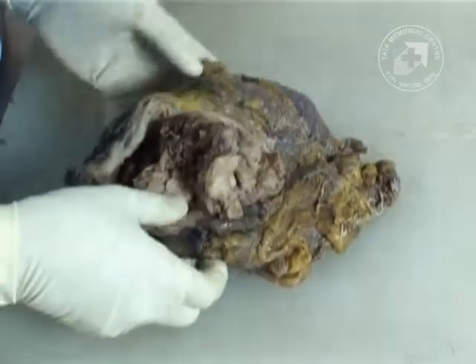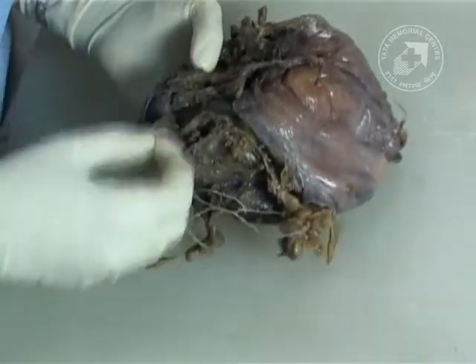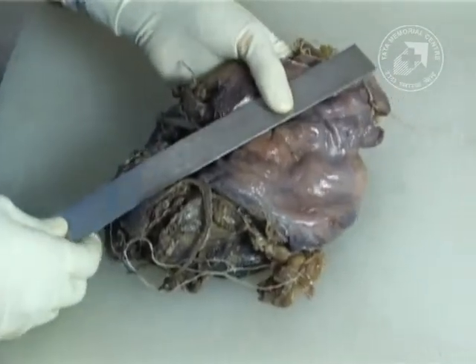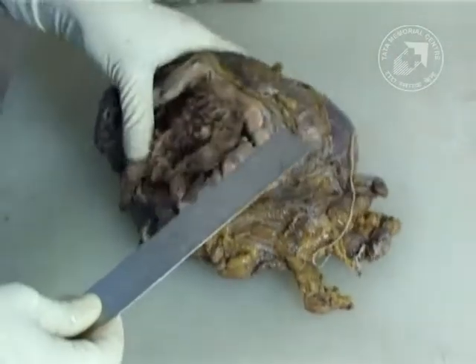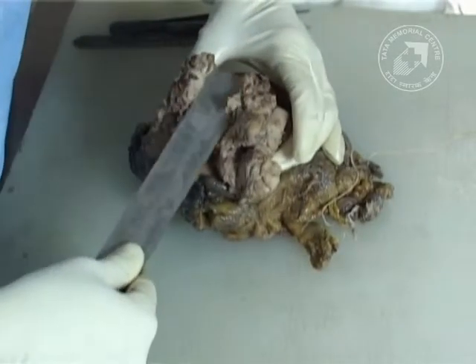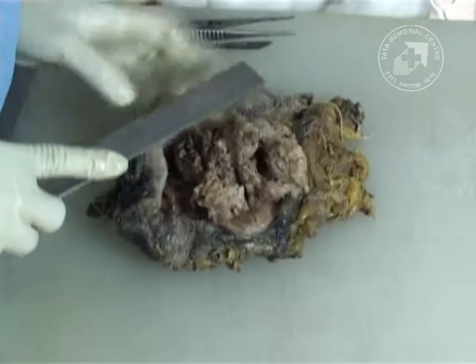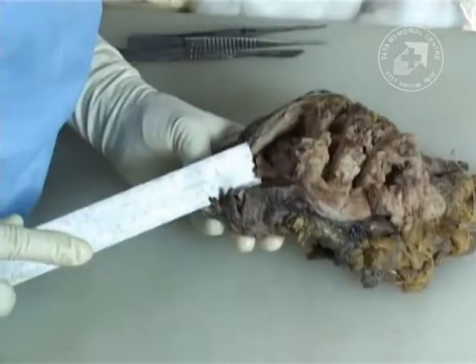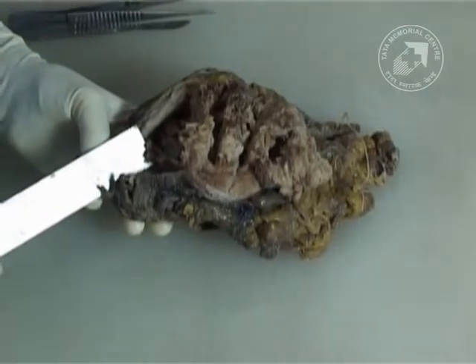This is the post-fixed specimen showing the tumor and the bladder. You can see the shiny peritoneal surface. Now we take the usual measurements of the bladder — the length, breadth, and the thickness — and then continue with the measurements of the tumor. The tumor is mainly involving the left lateral wall and part of the trigone and the posterior wall. We take the measurement of the distance of the tumor from the distal urethral cut margin, which is an important margin to be assessed.